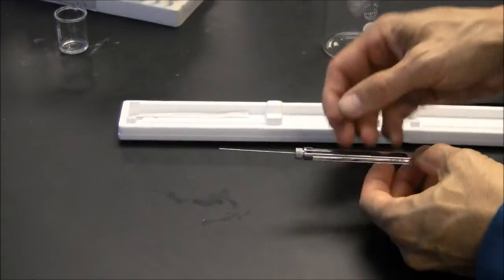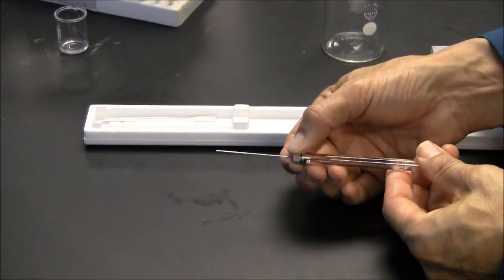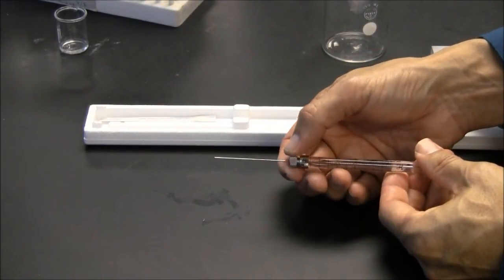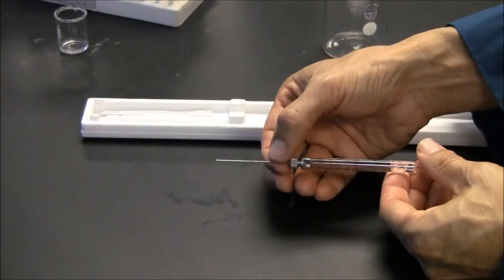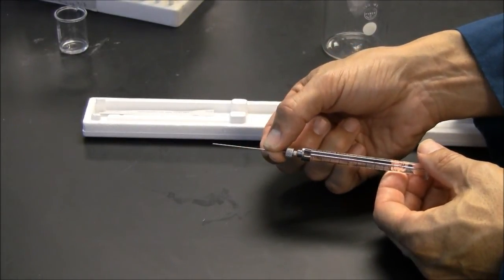I did buy syringes that have a removable needle. So if your needle does get clogged, we can, in this case, replace the clogged needle. But it's best if you never clogged it at all.